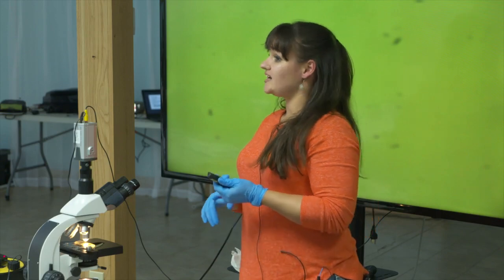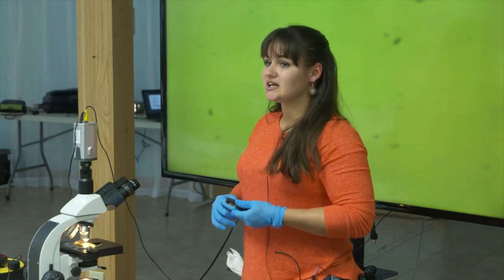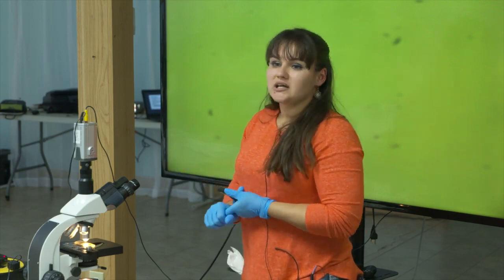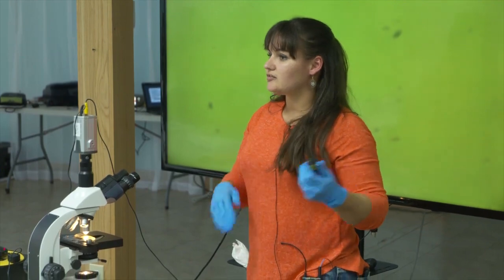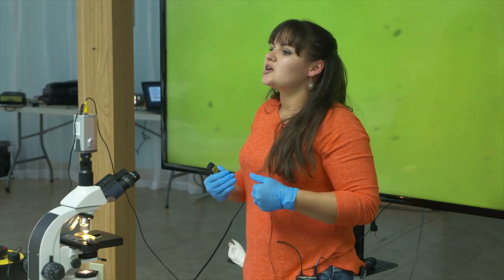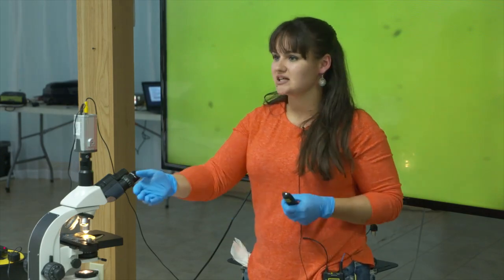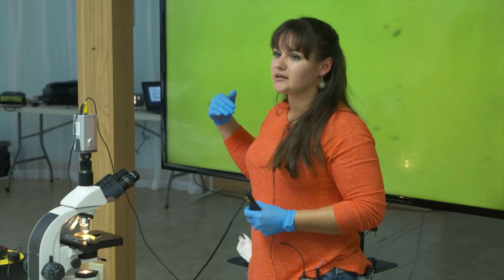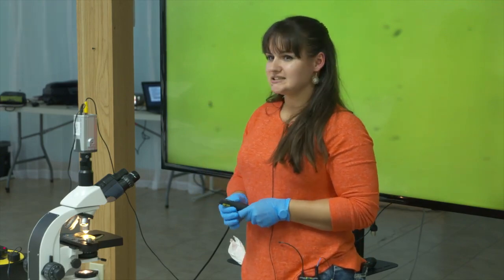You can take the scrapie tag, your ID tag, or a name. I have a friend with close to 20 goats who knows every one of them by name. What we're looking for is a treatment threshold: for strongylids and barber pole worm we're looking for one threshold, for coccidia we're looking for another — and coccidia typically has a higher threshold before you want to worm. This is one thing people don't like about this versus FAMACHA, because it takes time. But this way you're only treating the animals that need it.